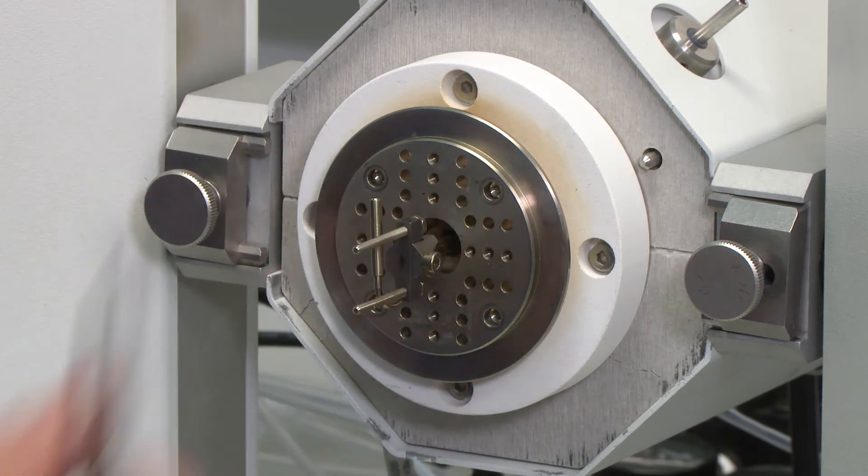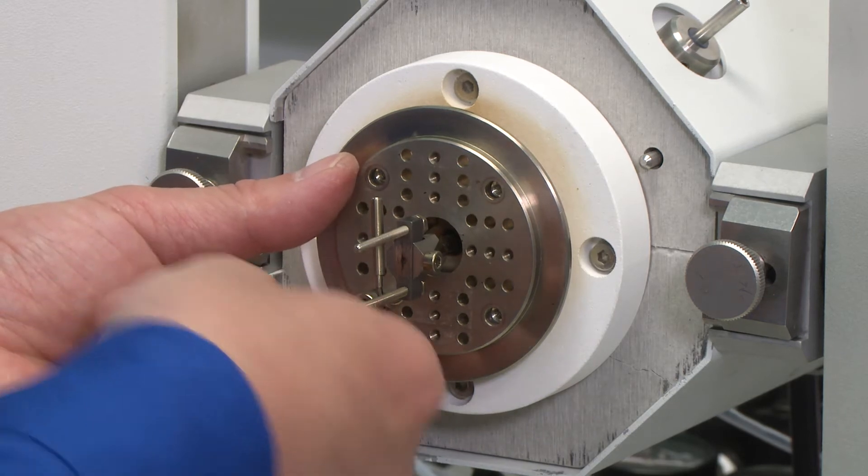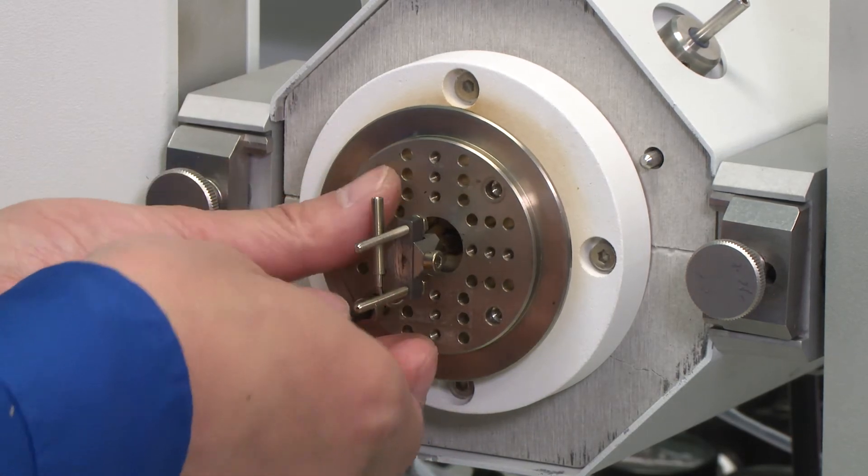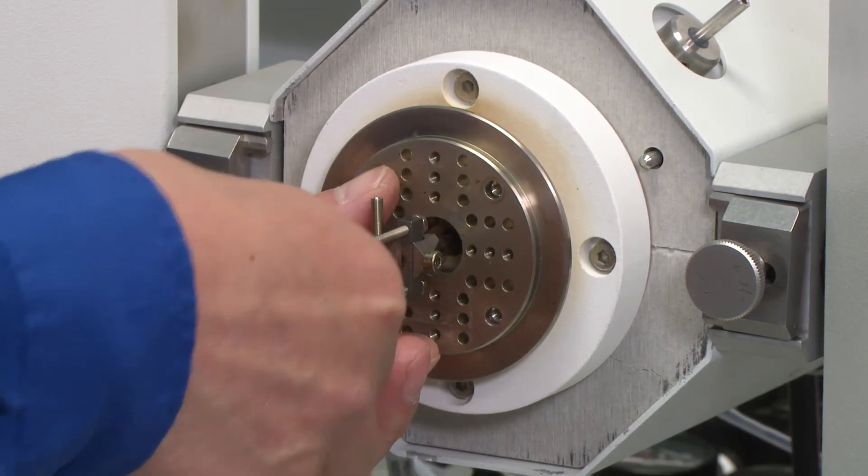So once we turn that geometry disk to the correct position, we are going to put these nuts back to secure the geometry disk.